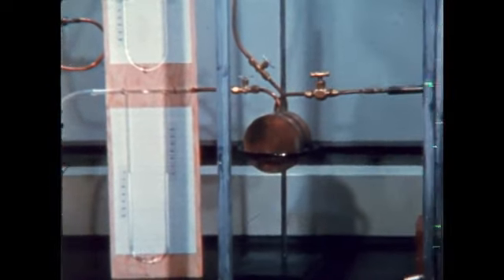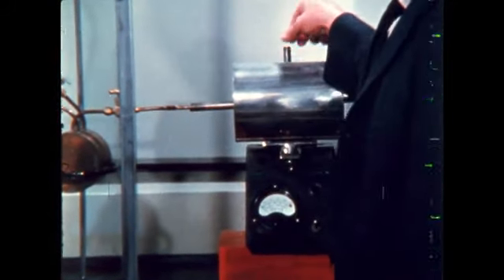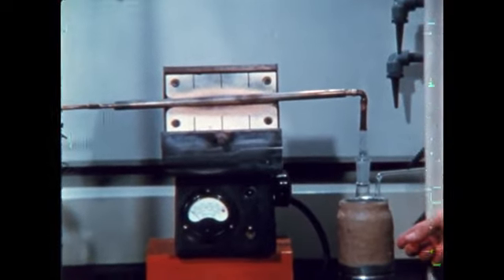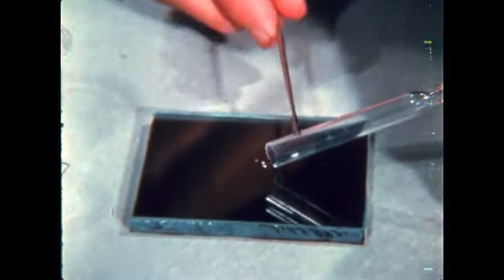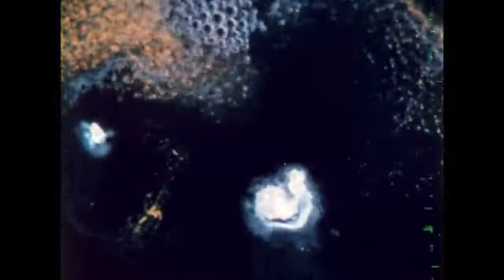The gases mix, then pass through a nickel tube heated to 400 degrees centigrade. The product collects in this cold trap. A white compound is formed. It is xenon tetrafluoride. The xenon tetrafluoride reacts vigorously with water, producing an unstable yellow intermediate which decomposes to give an aqueous solution of colorless xenon trioxide. Similar krypton compounds have also been discovered. The similarities of these compounds further strengthen our belief in the concepts of families of elements.